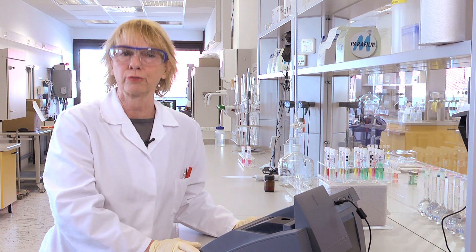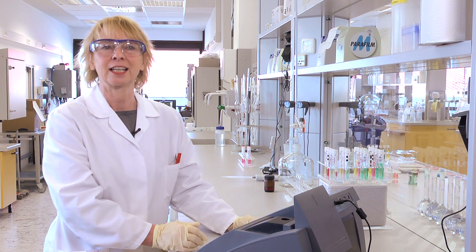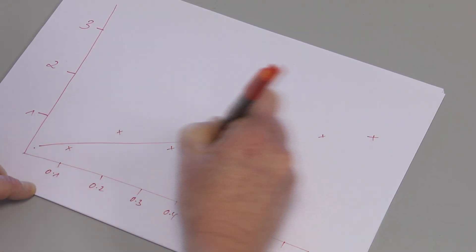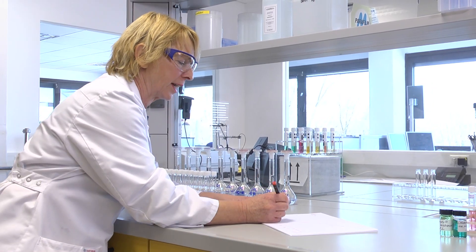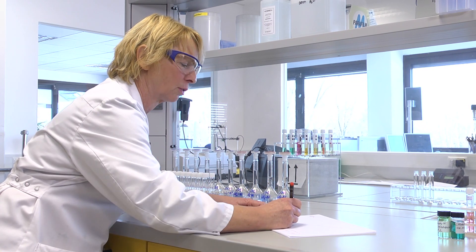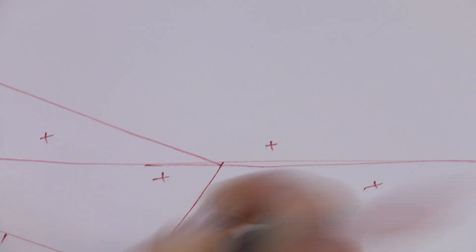Therefore, in order to determine the concentration of — in this case — nitrite, the ideal measuring wavelength is 525 nanometers. We draw a calibration curve like we used to in the past. Unknown sample concentrations can be determined by comparing the absorbance value of the sample with a calibration curve. This is a rather time-consuming procedure.